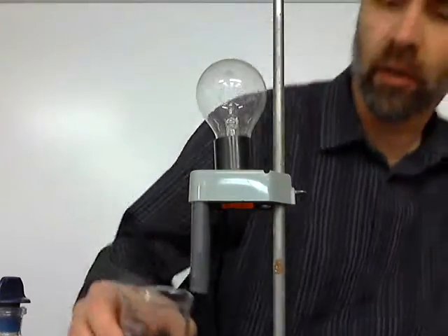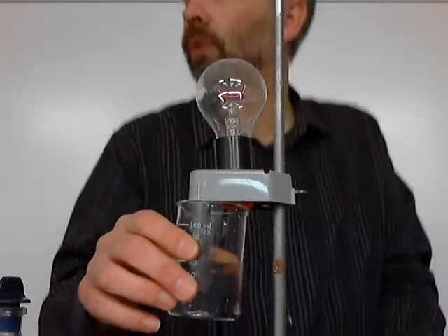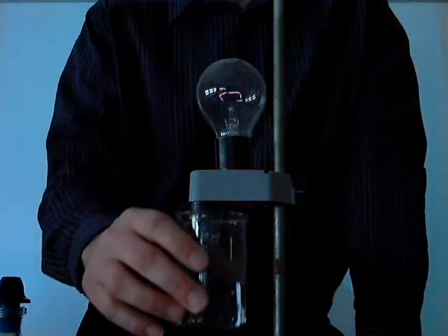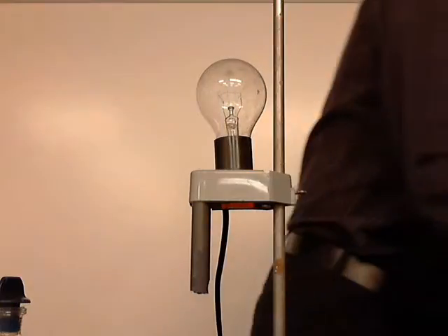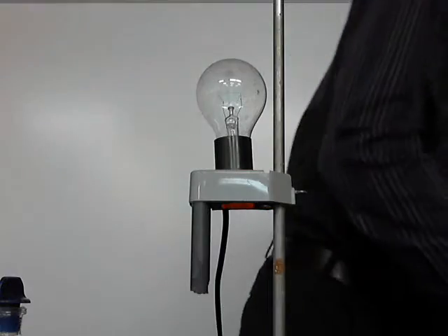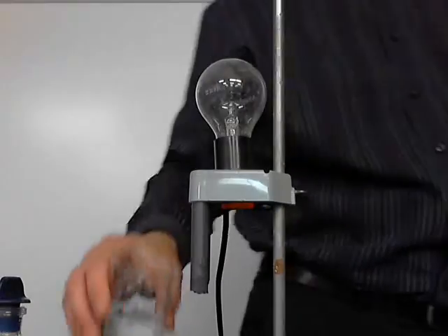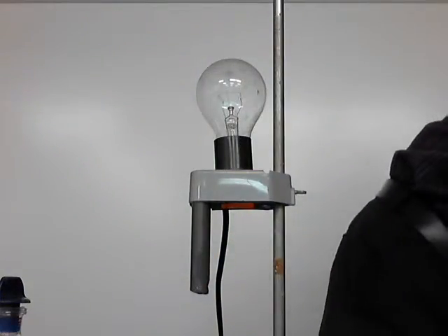But now when I test the vinegar, which is also an acid, not so much. Just barely lights that light bulb. If you turn the light off, you can probably see even better. Okay, see it? So turn it back on. I have to explain to you the difference, and it has to do with the electrolyte, same thing we talked about before, how well it dissolves in water to form ions. The specific ions we're talking about, however, are hydronium or hydroxide ions. So let's talk about that now.